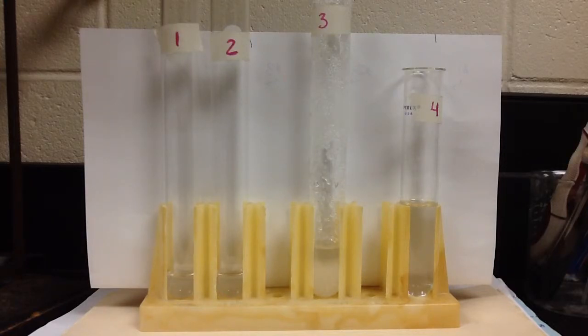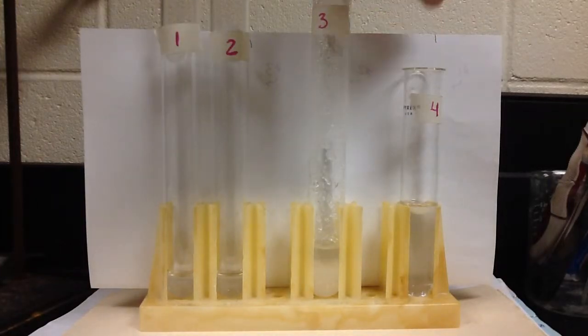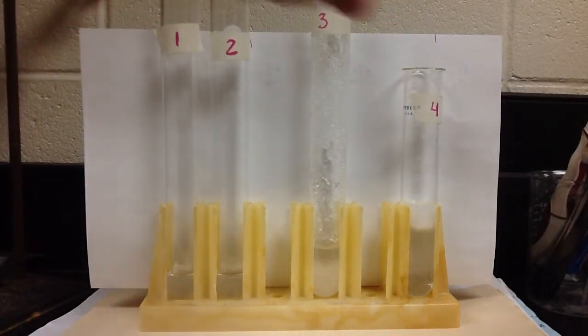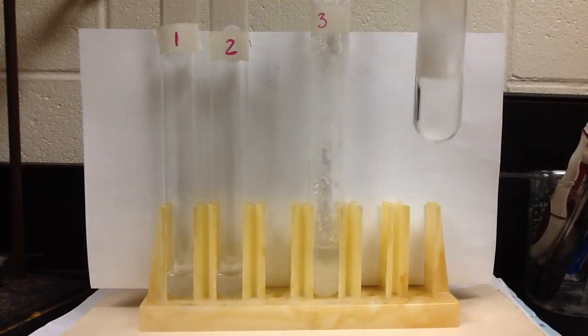So our theme has been, if you have a clear liquid and we want to know what type of solution it is, you add some solute crystals to it. And when we do that, hopefully what we're going to see is that we've made a supersaturated solution.